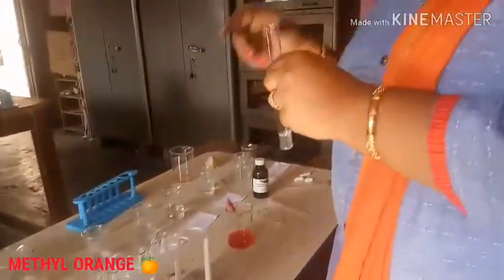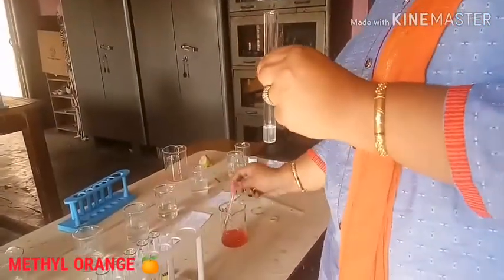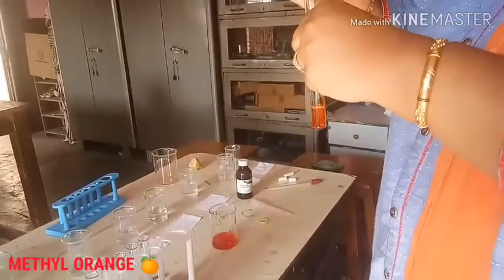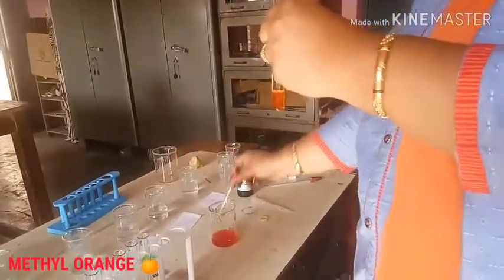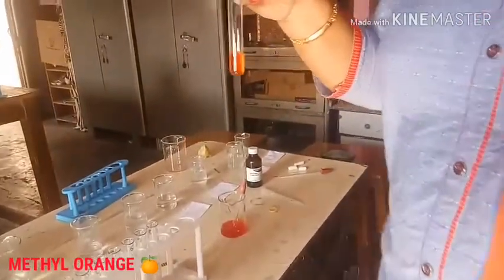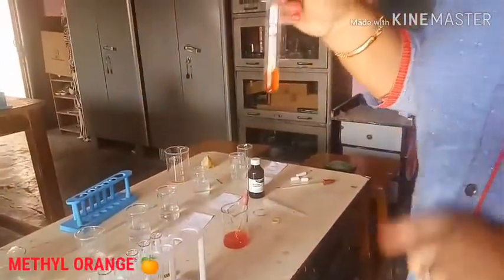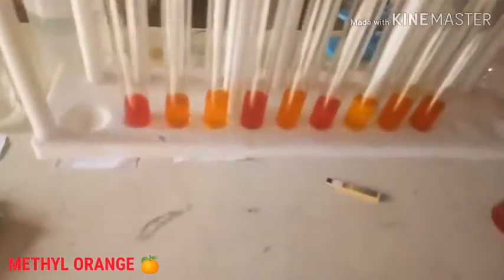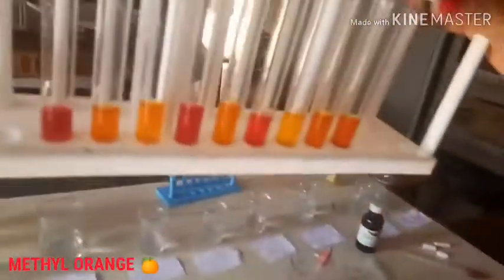Our last sample is detergent. Detergent is also a kind of base, and in the same way it has also given the deep yellow color.